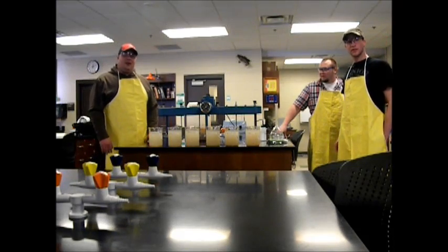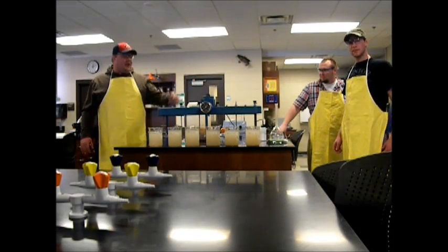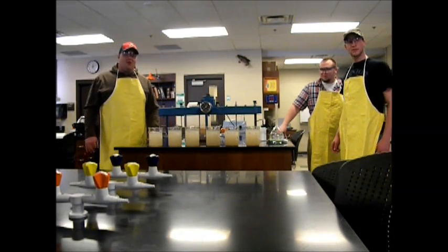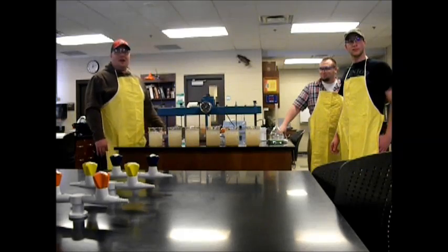Hi, I'm Eric. These are our lab mates, Jacob and Anthony. We are going to be simulating a jar test today.